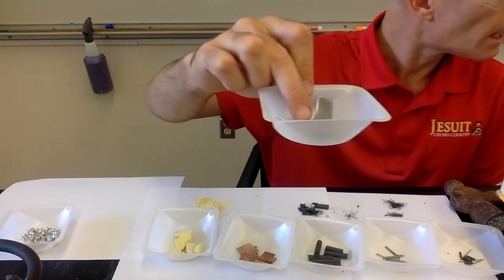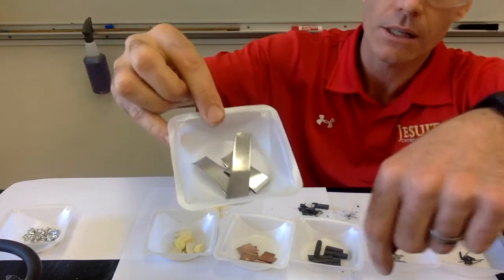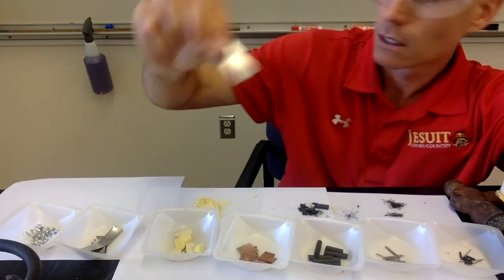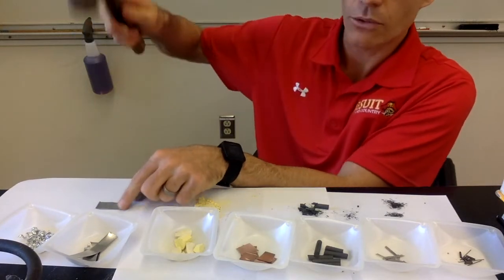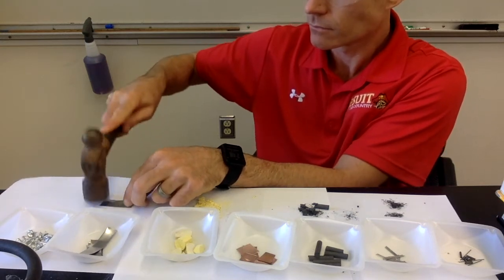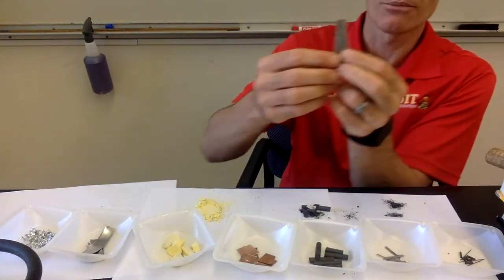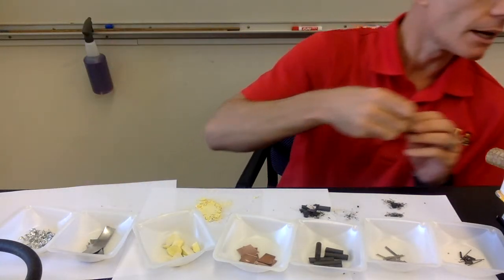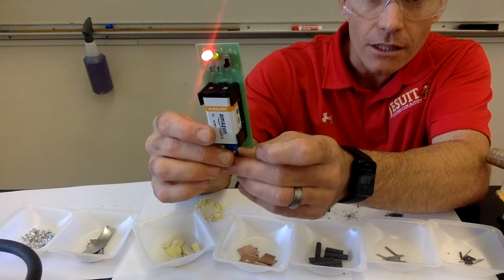This is substance F. So substance F, you can record the physical appearance of substance F. See what it looks like. And we will do the test with the hammer. So I'll hit this with the hammer again. So I can bend it, I can change its shape a little bit. You can dent it a little bit, but it doesn't crumble. It stays all as one piece, just maybe changes shape a little bit. In our conductivity test, with that same substance, substance F, does conduct electricity, the light's turning on.